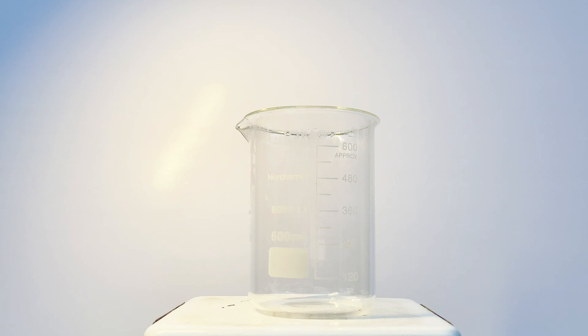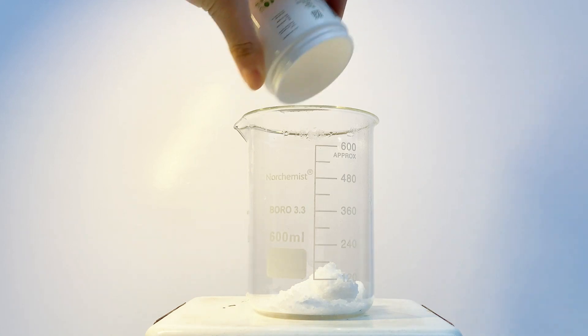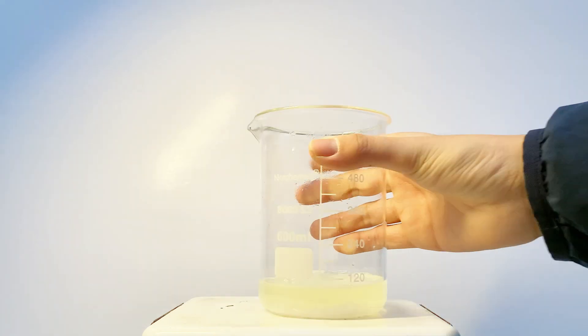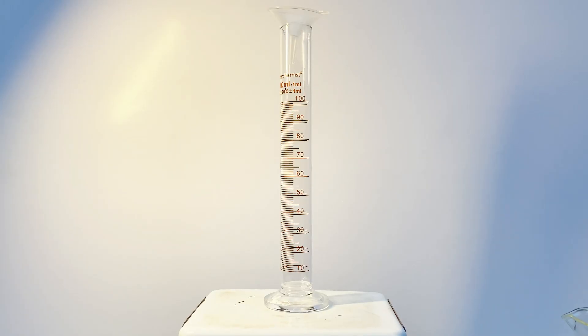Anyways, I roughly set things up and put onto my hot plate a large 600ml beaker. Into this, I'll pour in 75g of potassium iodide powder, and I dissolve it with a good amount of water. Then I dropped in a stir bar into the beaker and started mixing to dissolve it. When it was all dissolved, I set it aside and moved on to my hydrochloric acid.